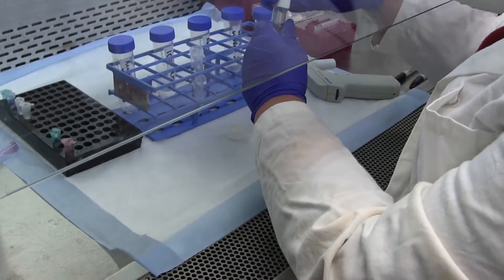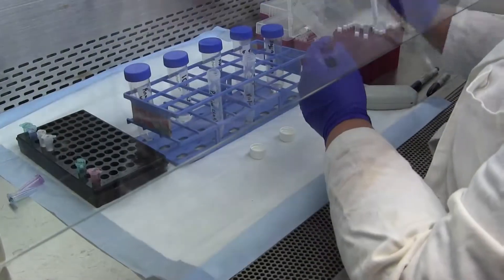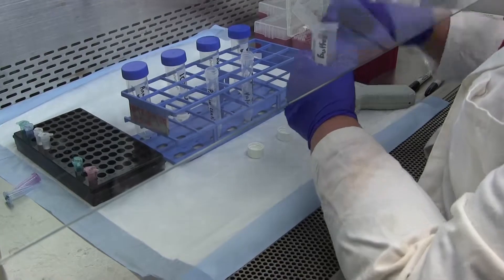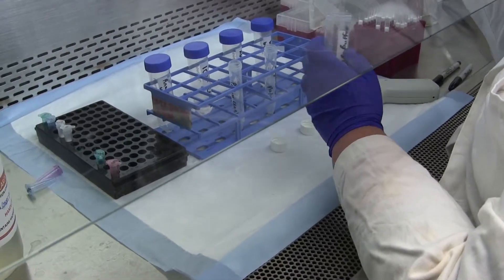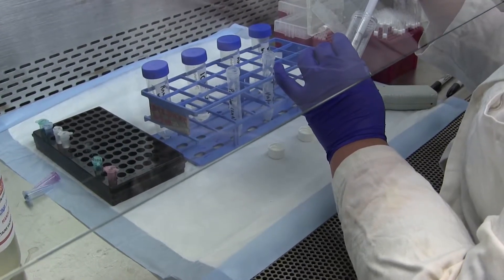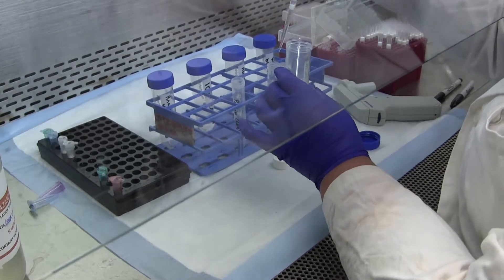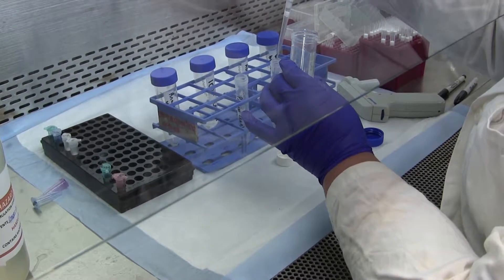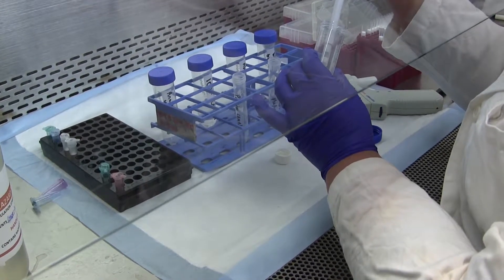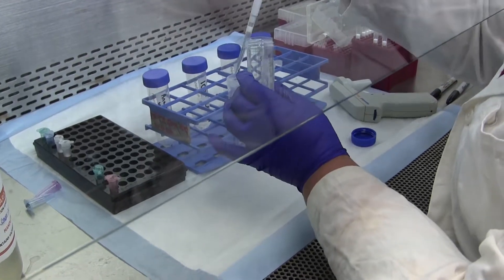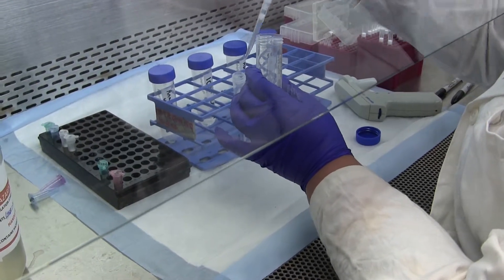Now we've gotten our samples back out of the refrigerator and we're going to add 500 microliters of RNA lysis buffer to each sample. So our samples are 250 microliters, we're adding two times the volume in this instance.